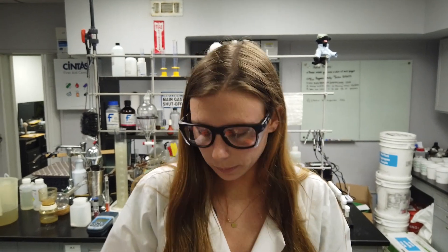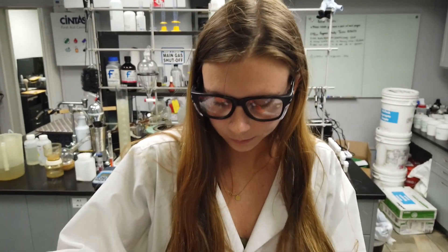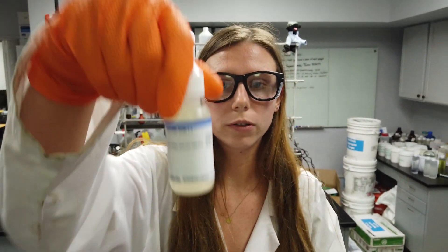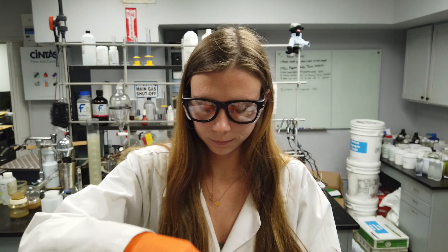Add 10 drops of sulfuric acid 1 to 1 and swirl to mix.